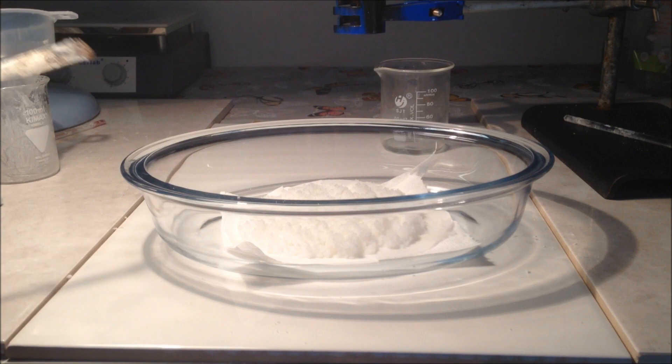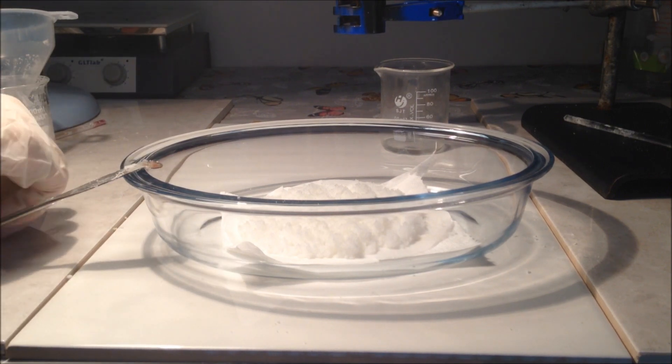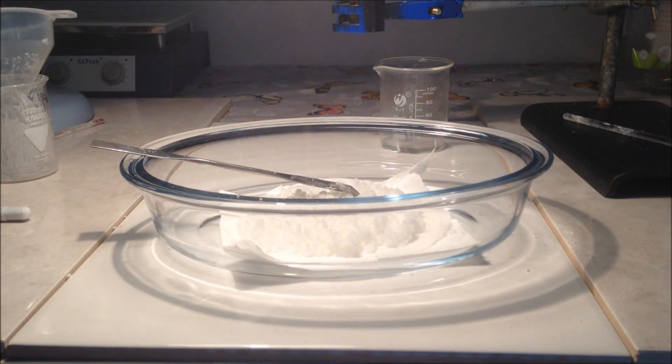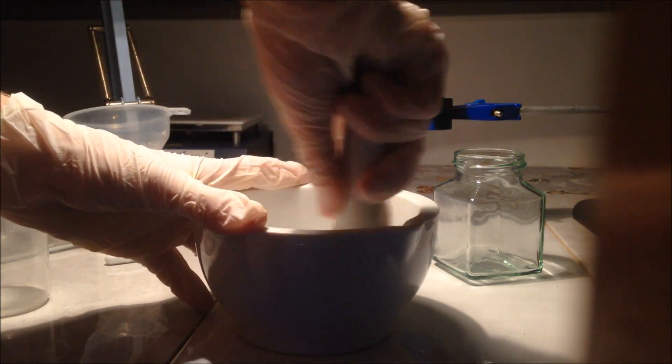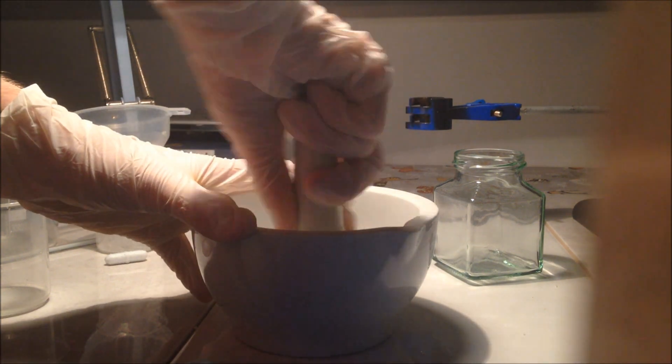Once I was happy with that, I just left it to dry under a hot lamp. You can see I'm moving it down a bit there, but it was still very lumpy at the end of this. I left it for about two days to dry.